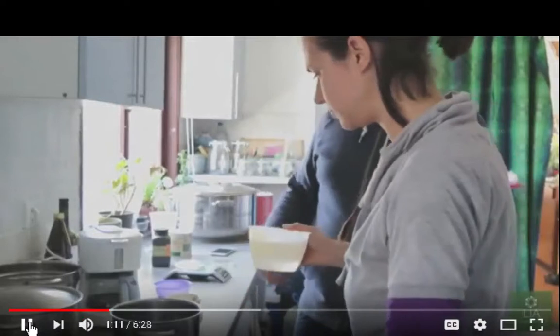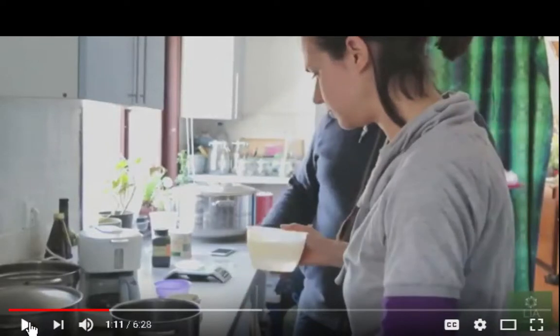Now, okay, so when I set up my solution, what I'm going to use is called potato dextrose, and I probably have to send away for some stuff.